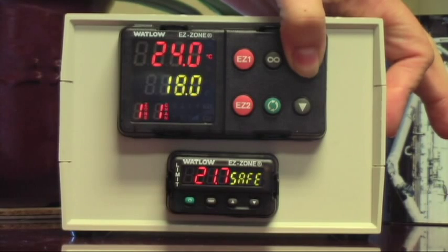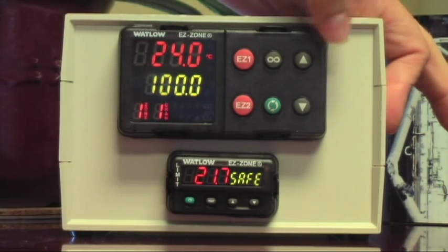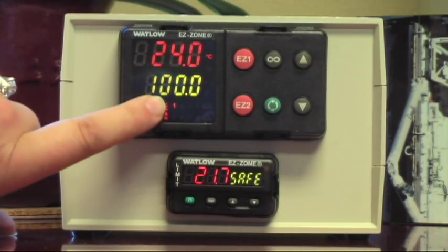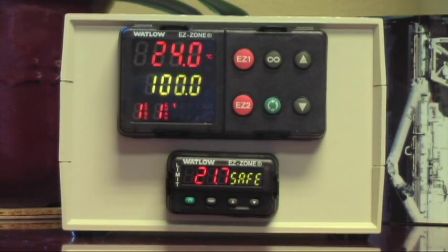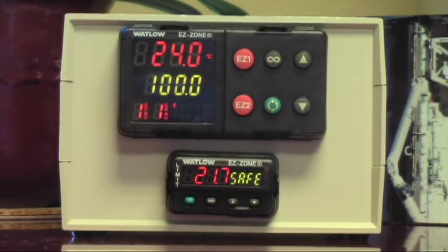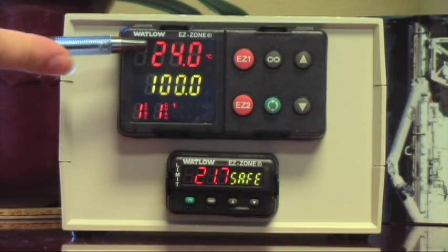Because green is where I want to go. Yep, and you're going to be setting the oven for 100 degrees — there it is. That means the controller is now calling for heat. So it's turned the power onto the heaters and it's calling for heat, because inside the oven it's 24 degrees C but green, where we want to go, is 100. So it's calling for heat. And if this were a real oven and not just a box sitting on your desk, this would be going up now.